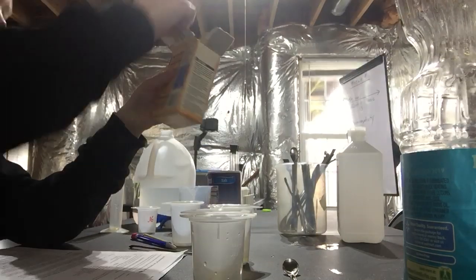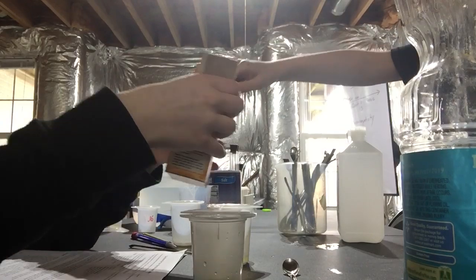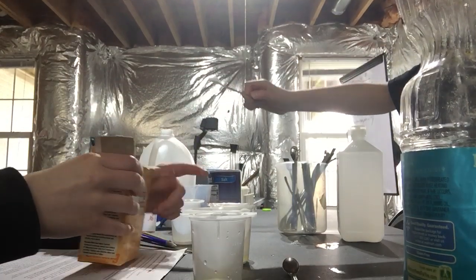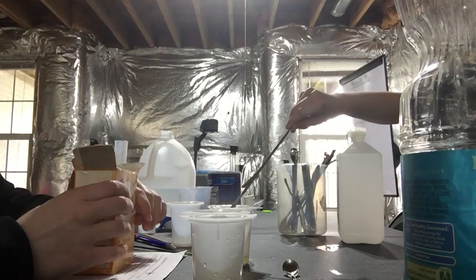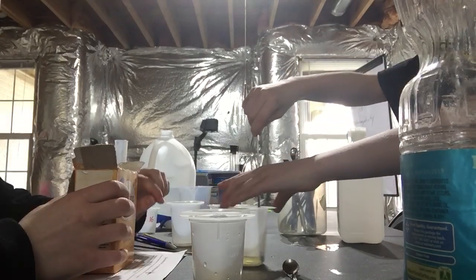Now take a little bit of baking soda. Put it in here. Don't drop it like last time. I think so. Now stir. With this? Mm-hmm. I should definitely hold on to it.